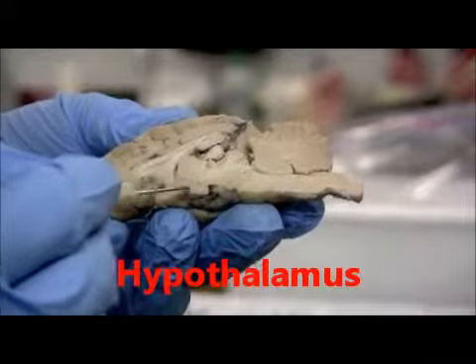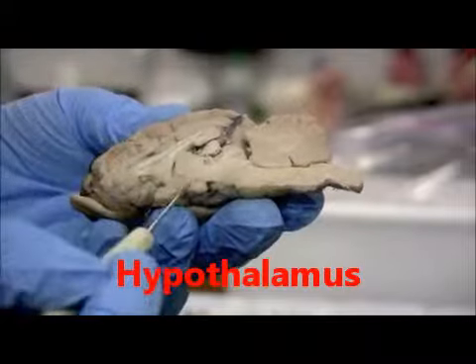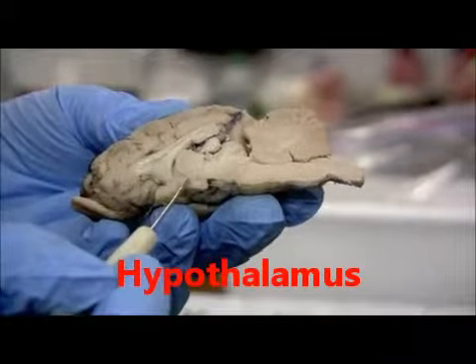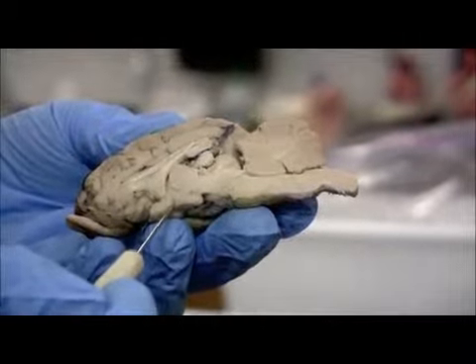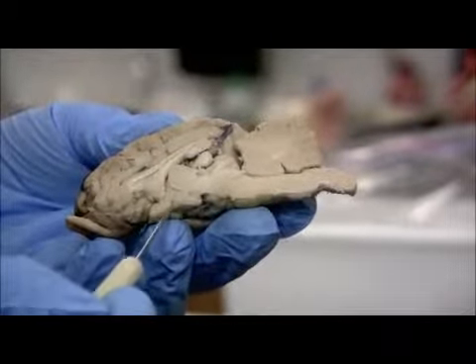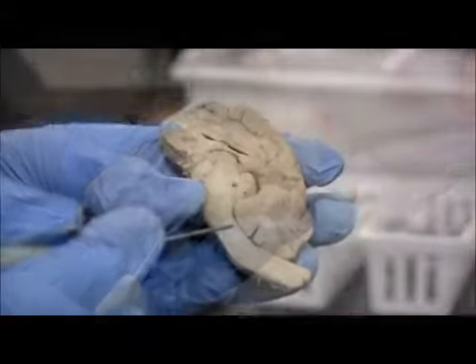So this little region, the hypothalamus, is responsible for all sorts of functions, and it does produce a couple of hormones and stimulates other hormones to be produced or distributed from the pituitary gland. This is where the infundibulum would be, and the pituitary gland would hang down from that.